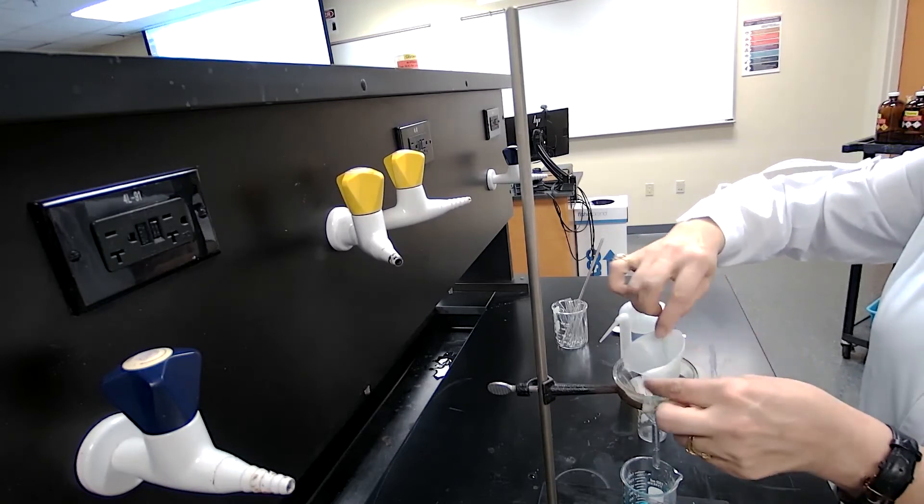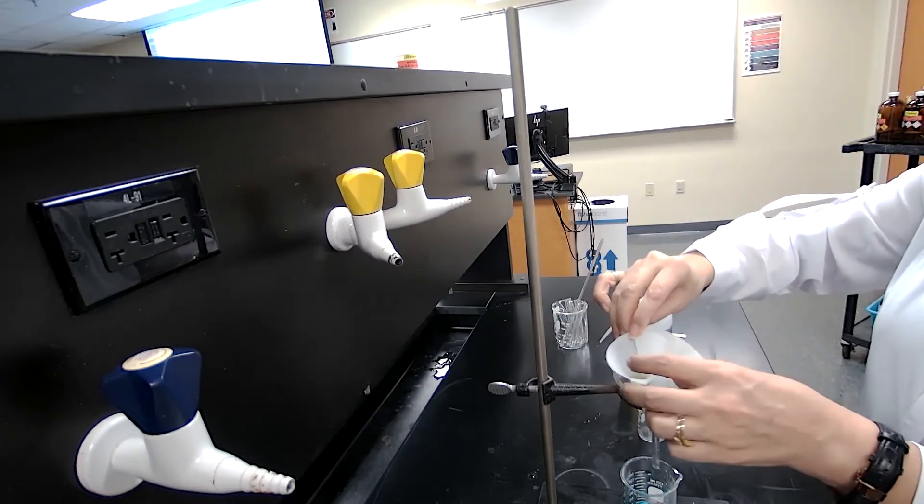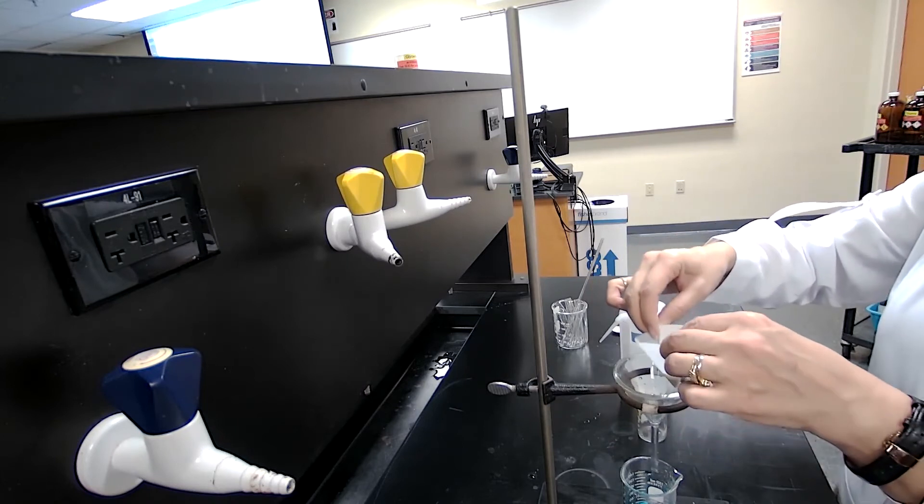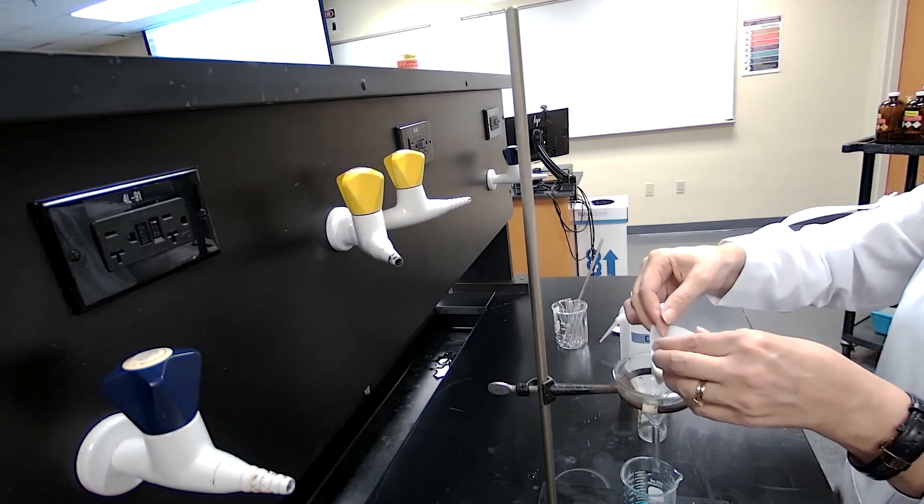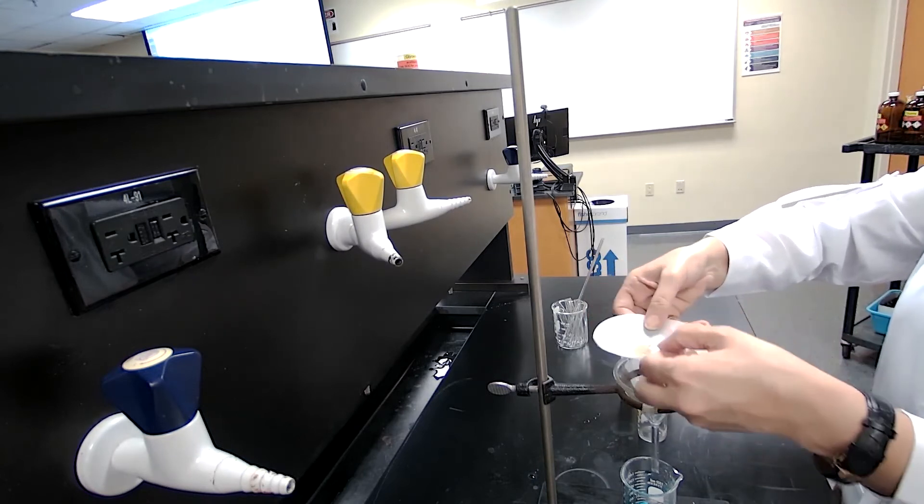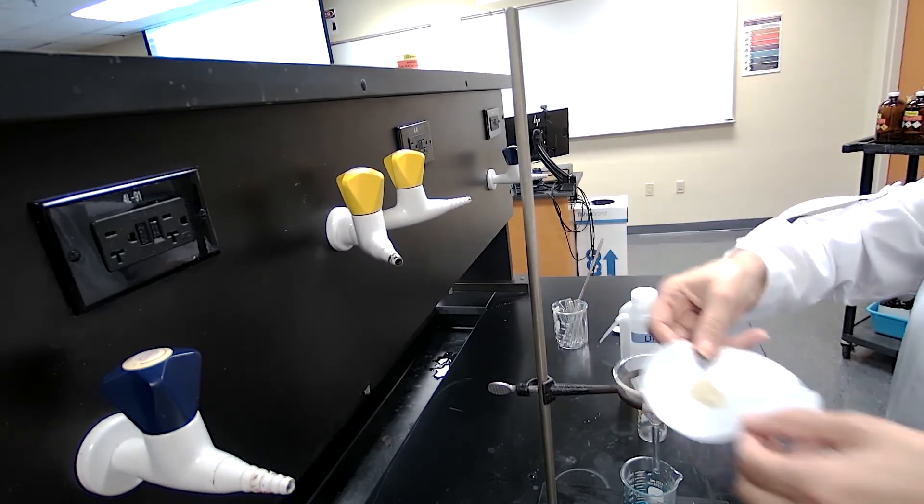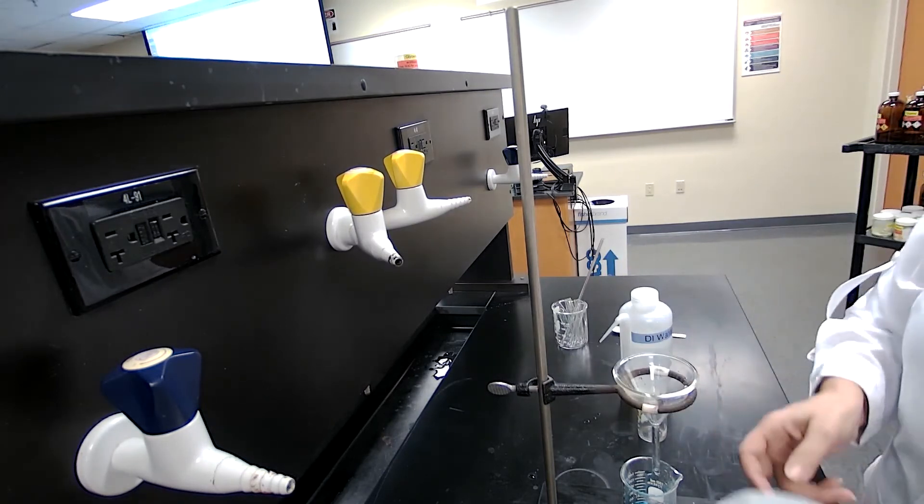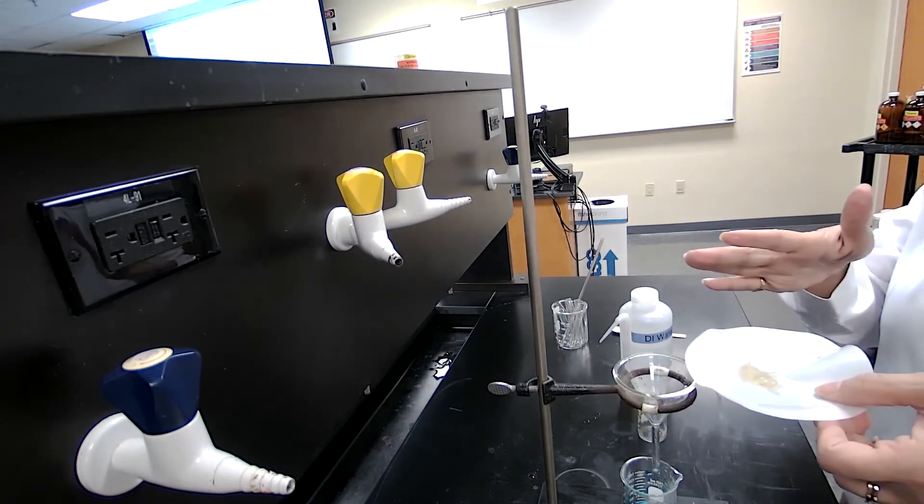Now, if you were going to recover this material or the procedure asks for further steps, you can take the filter paper out of the funnel, place it on a watch glass, and let it air dry. Then you have dry sand.